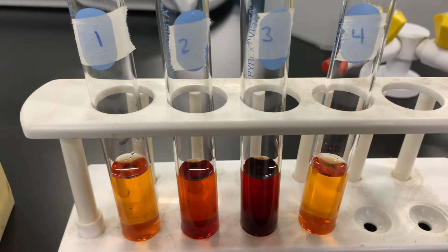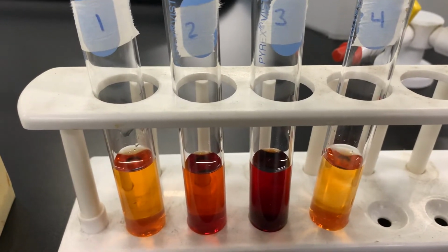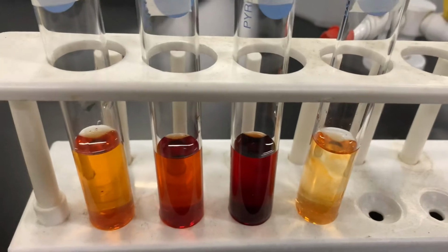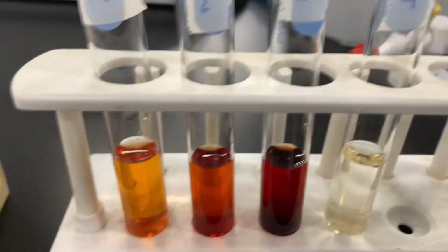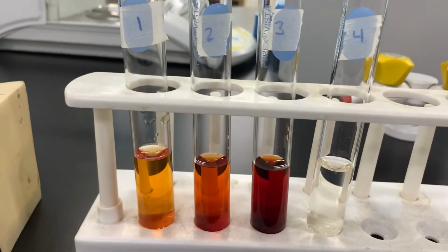1, 2, 3, 4, 5, 6, 7, 8, 9, 10. Maybe I had an extra drop. I was switching my focus there. Oh, and then we have something different going on here. So those are the results that you're going to be analyzing today in class.